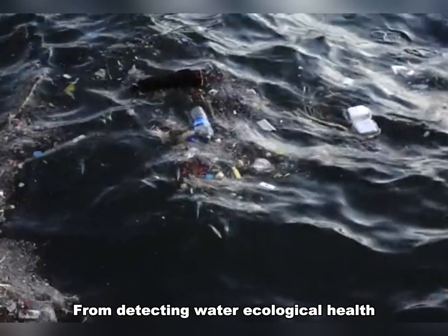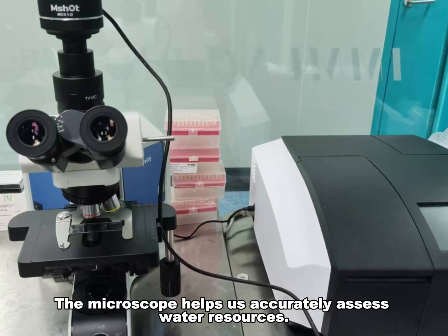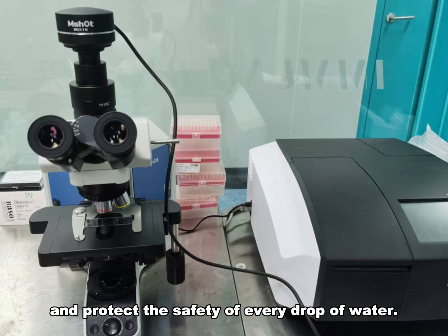From detecting water ecological health to identifying emerging pollution risks, the microscope helps us accurately assess water resources and protect the safety of every drop of water.